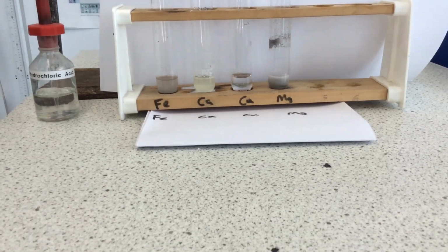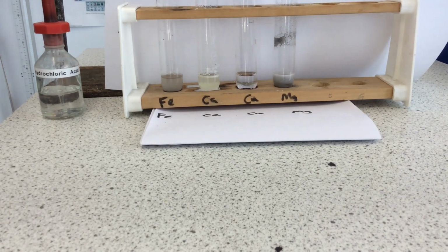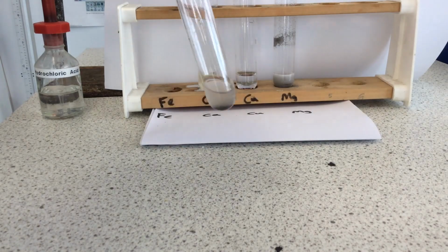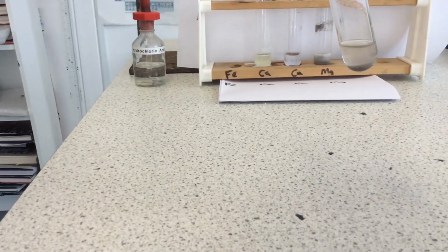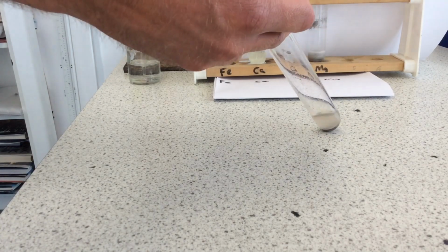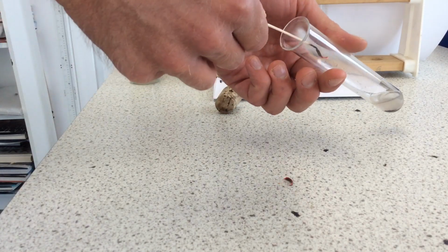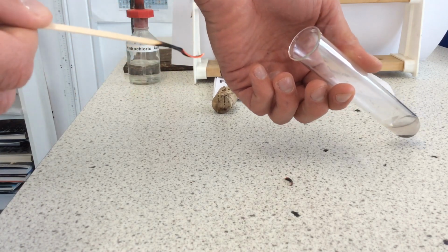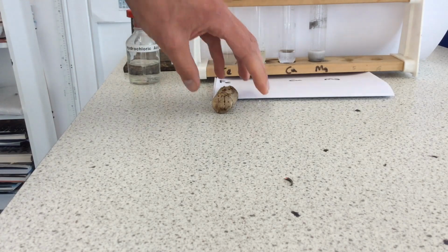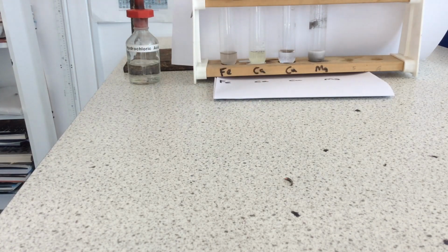So we're going to see if we can prove what gas it is. You have to bear with me because it's just me, so I'll try my best. The answer to what kind of test it is: the squeaky pop test. Try and give it enough room so you can see it. Right. Oh, just heard it. It did just work, but not a very vigorous one, partly due to me not having a partner to help.